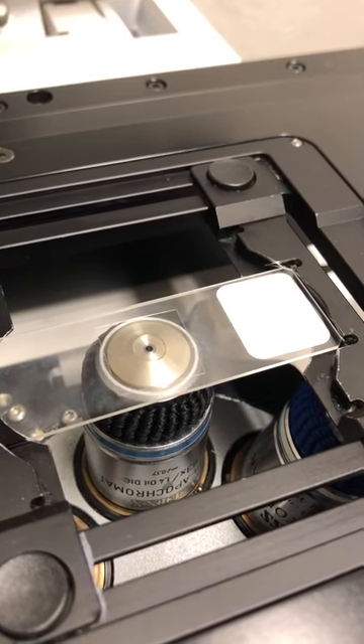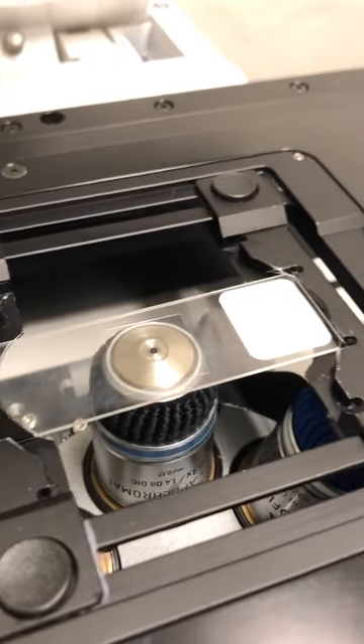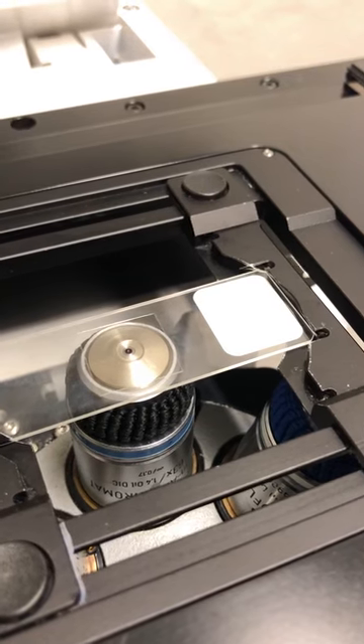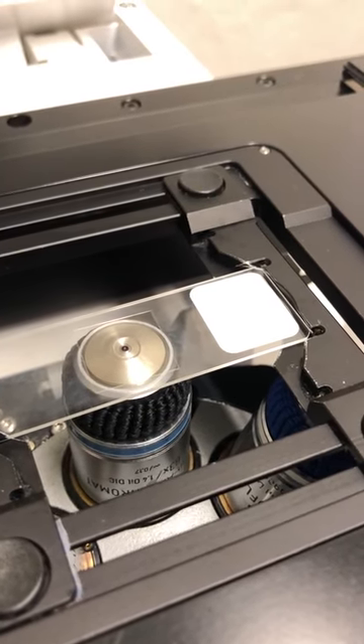Once you touch, you can see the oil slick. Just move a little bit down, because you want to be below your sample when you're trying to focus, so that you know if you go away from you, you're going to run into your sample. I will focus this by eye and will return to the confocal software once that's done.